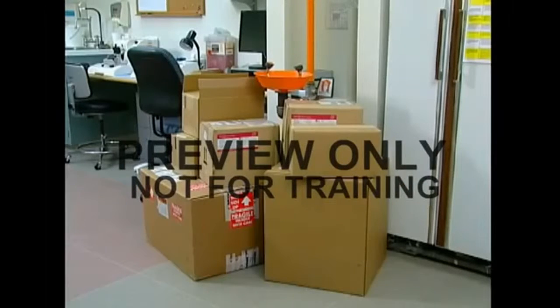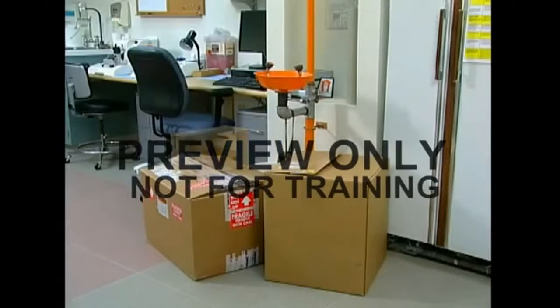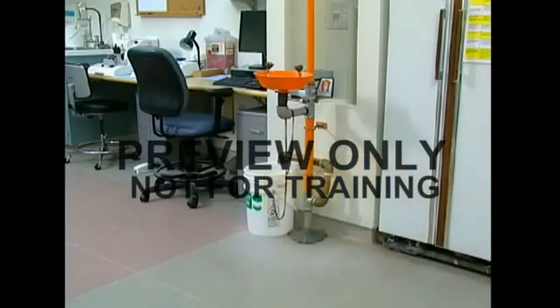It's important to make it easy for any victim to reach the showers and eye washes in your labs. Keep access routes free of equipment and supplies. Shower areas themselves must also remain clear.